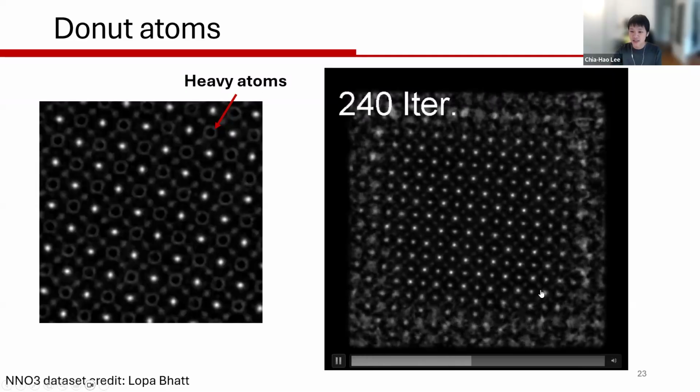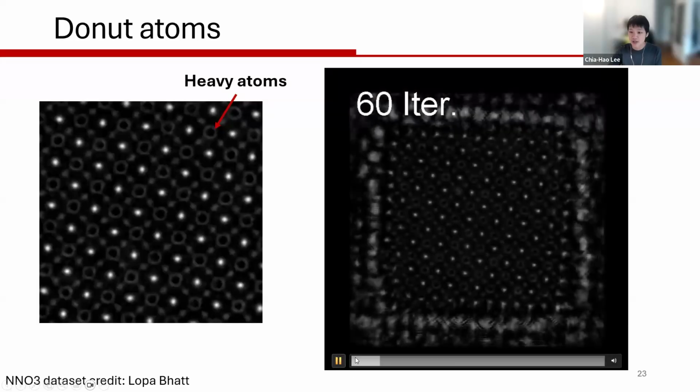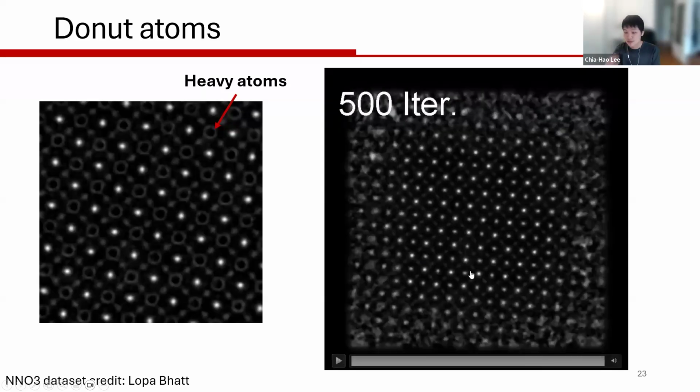And as you can see, this is just the depth sum of the reconstructed object throughout the iterations. I'm just going to play this again. You start from all black holes or donut artifacts, and by running a few hundred iterations with some real space blurring, you see that now we have corrected all the black holes. But this is just something to keep in mind: if you have heavy atoms and sometimes you see these bizarre artifacts, there are a couple of references that already touched on why we're possibly seeing this and how to cure it. Now it seems to be performing fairly stably in PtyRAD already.